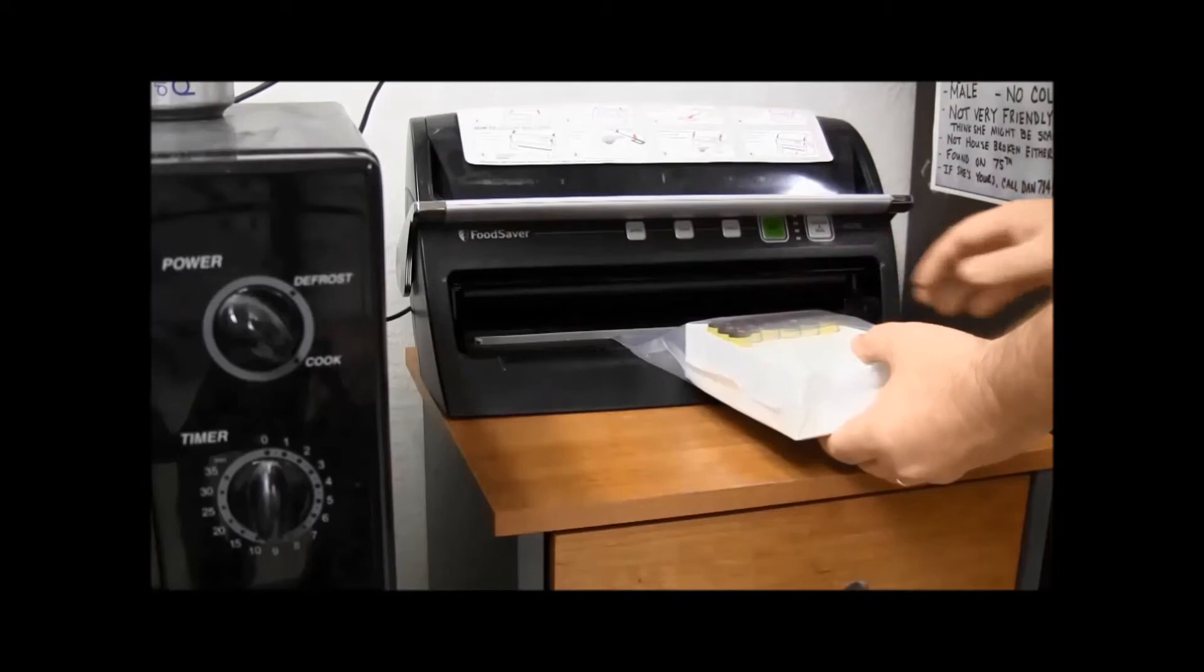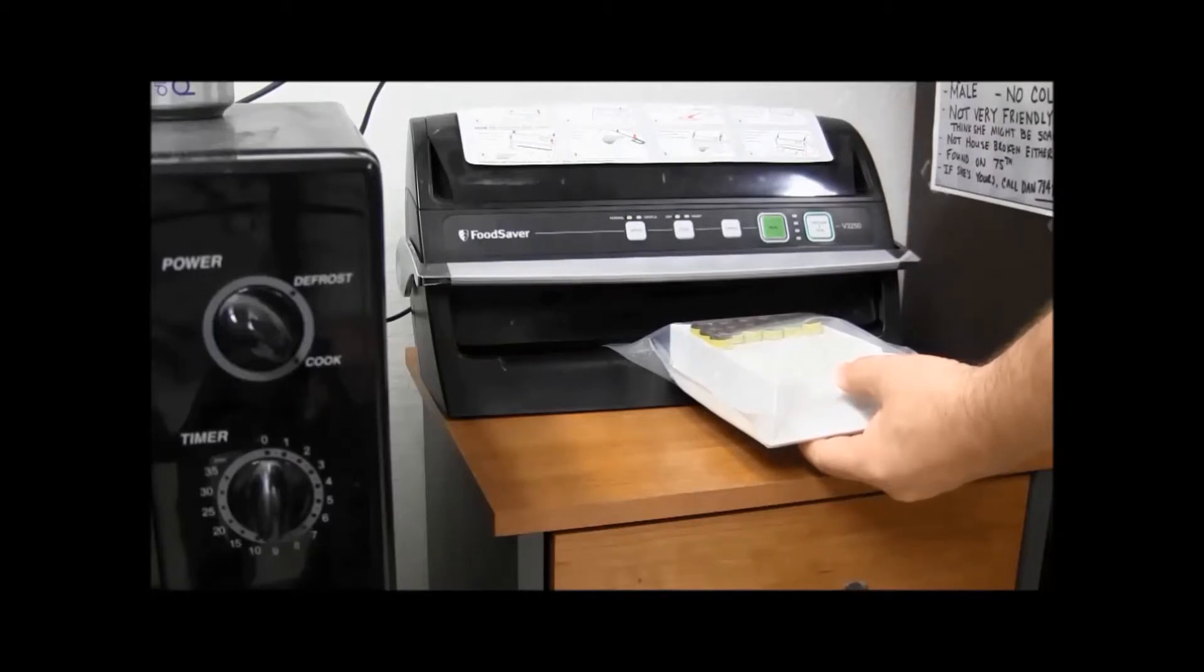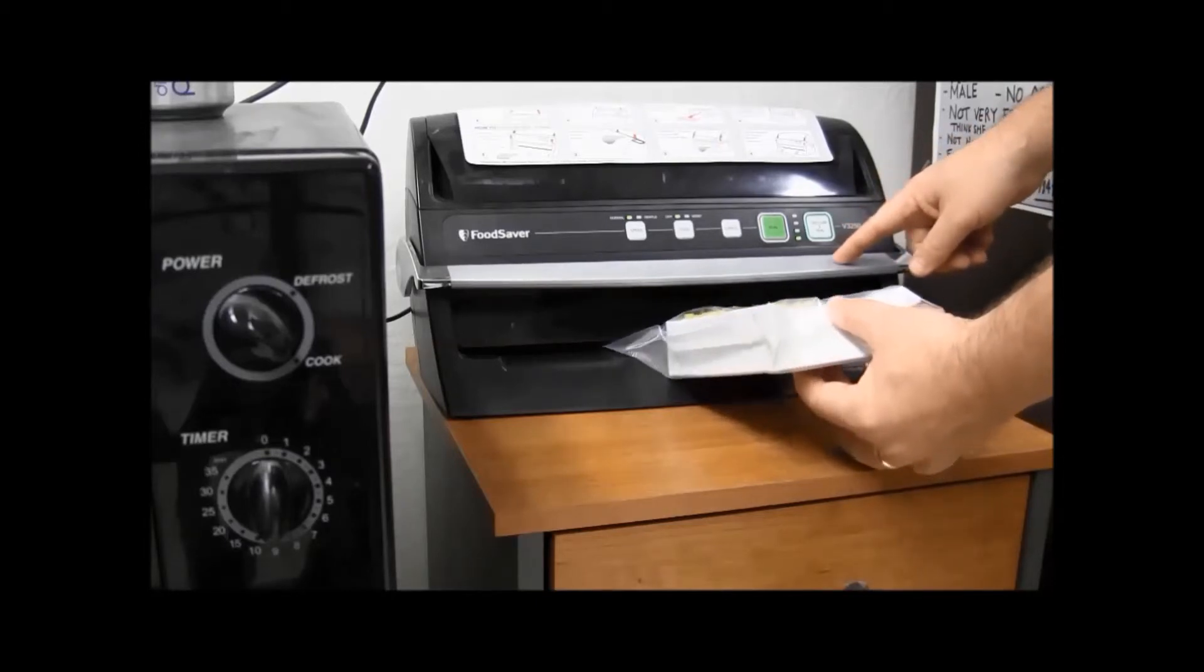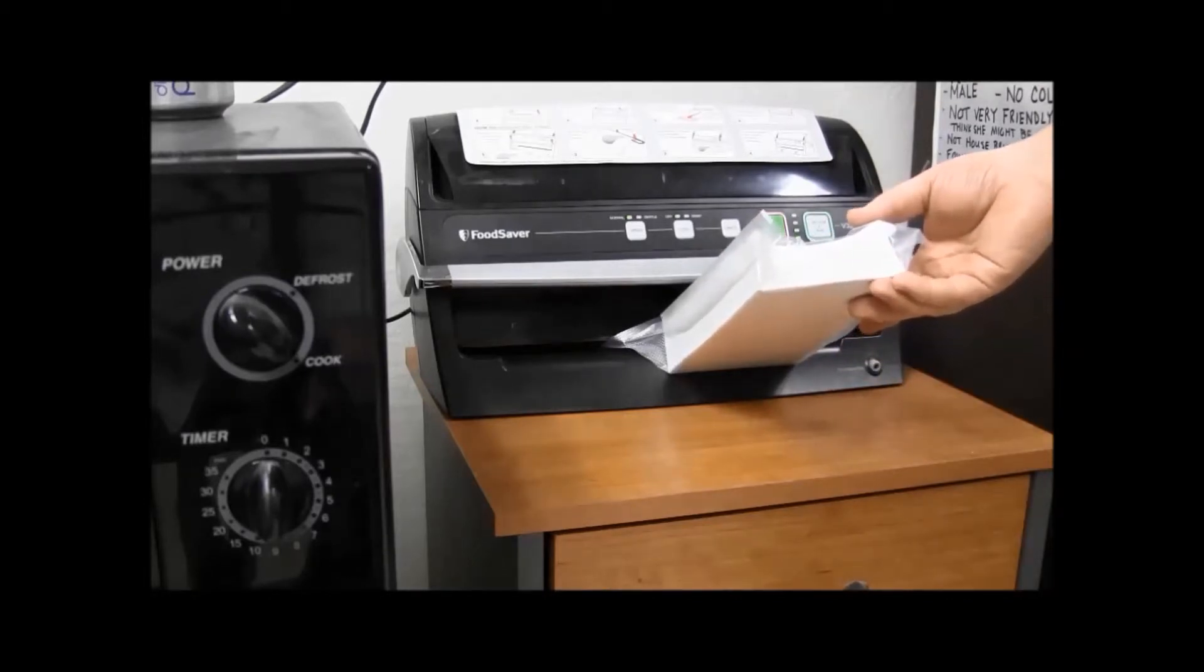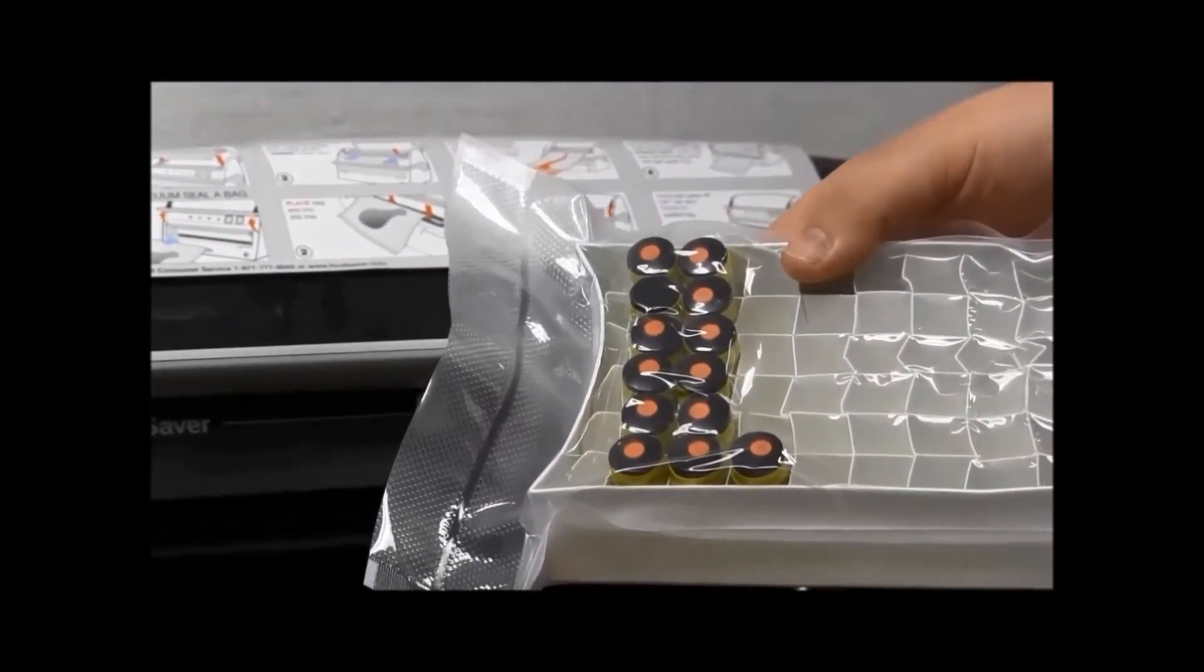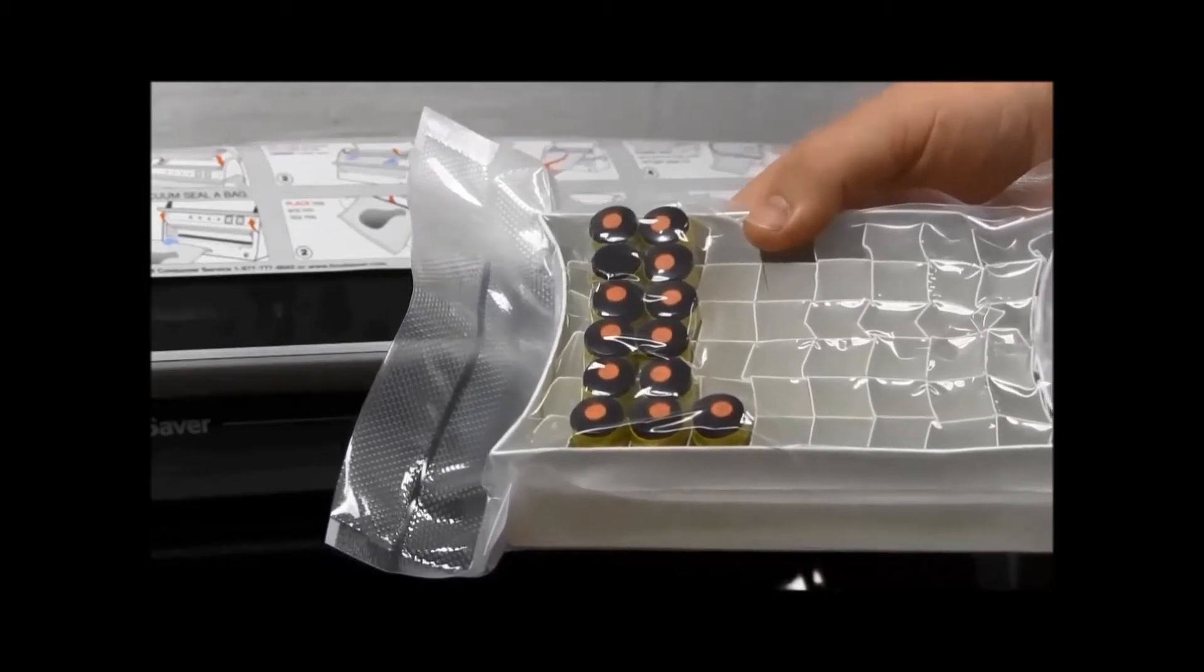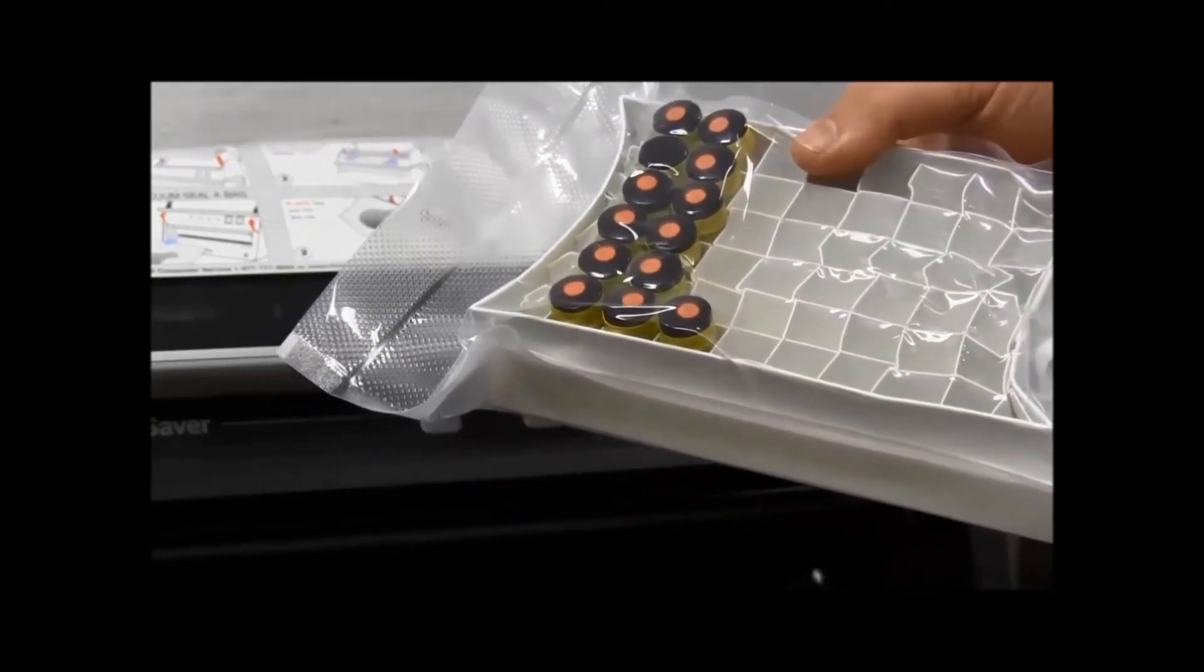Not only does it heat seal, it also vacuum seals. It's kind of nice to do that. You can use the vacuum seal aspect on this one, but we found that you need to be careful and not set it on high, otherwise your vials will leak or actually the vials can rub up against each other and break during transit.